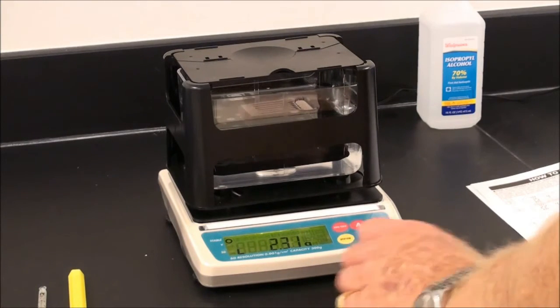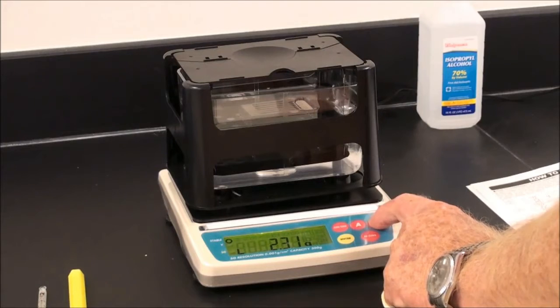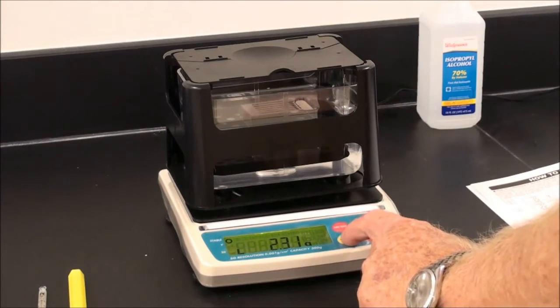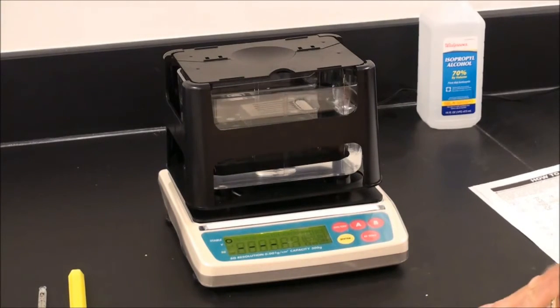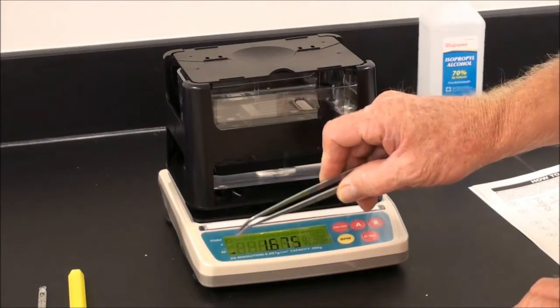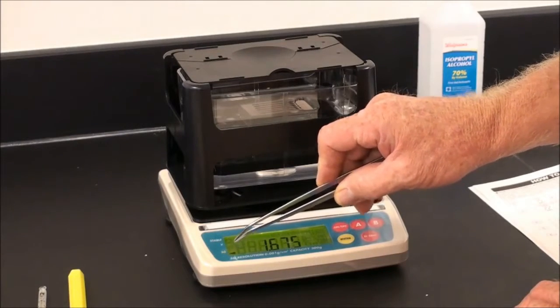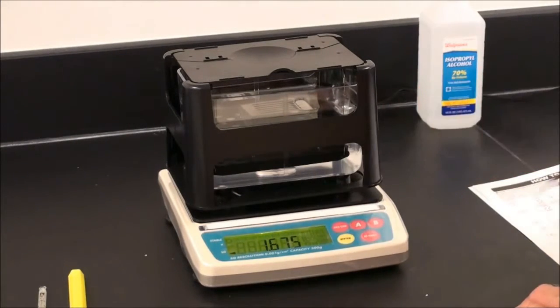At this time, press B gently, and then enter. The timing marks disappear. The stability indicator will appear, and then the mark will go to specific gravity. The specific gravity of this is 1.675.